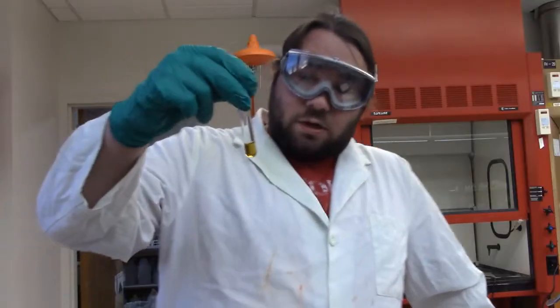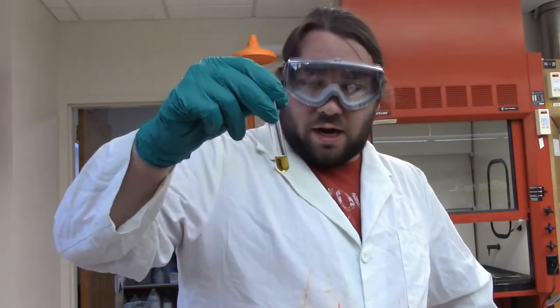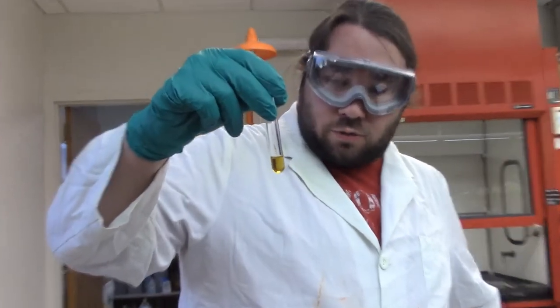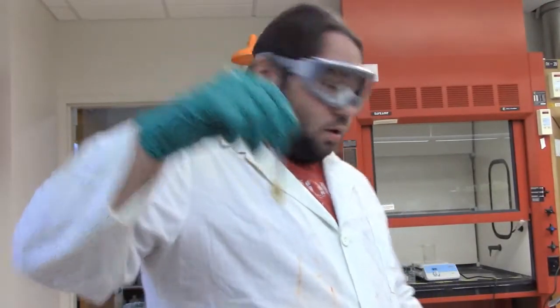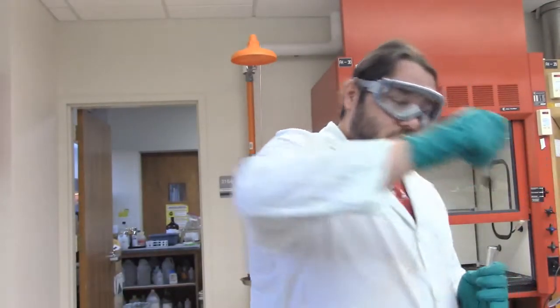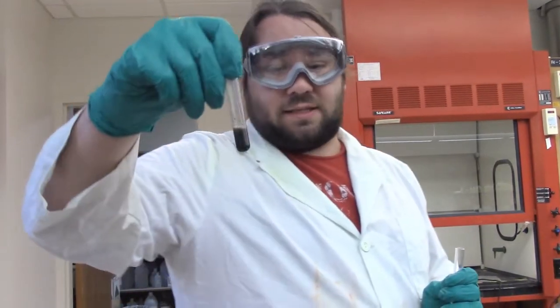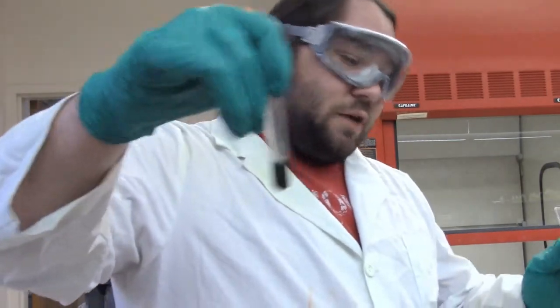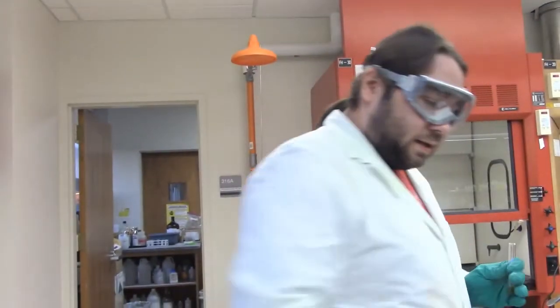Alright, so here is our yellow supernatant from step 7 or 8, whatever it is. So this is what we're going to use to test for tin right now. And we got that yellow color going for us. And then here, I just mixed it back in the solution, so it looks cloudy, but this is the precipitate that theoretically has our other group 2. So let's see what we do and don't have. We're getting to that point.